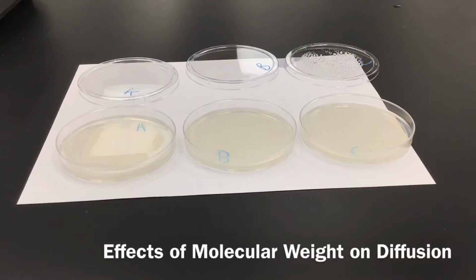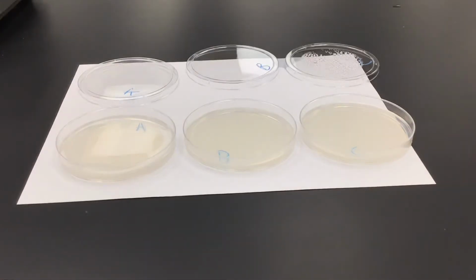This is number 3 of exercise 4.3. Here we're going to observe the effects of molecular weight and concentration gradient on diffusion rate. So we have our 3 agar plates that are in front of us.